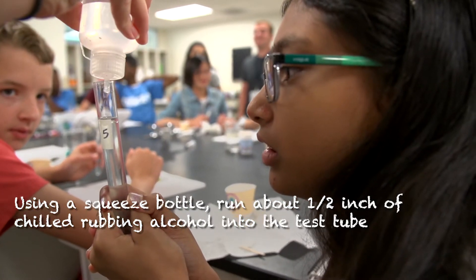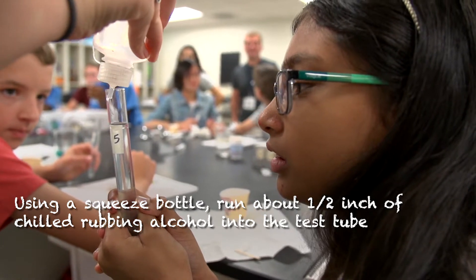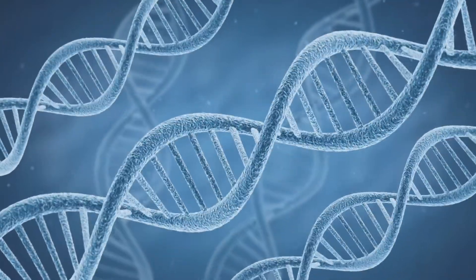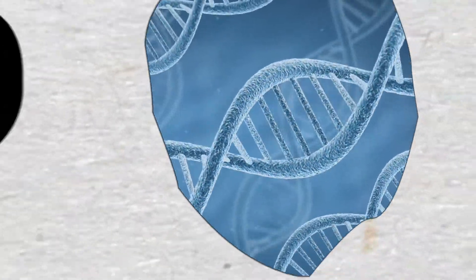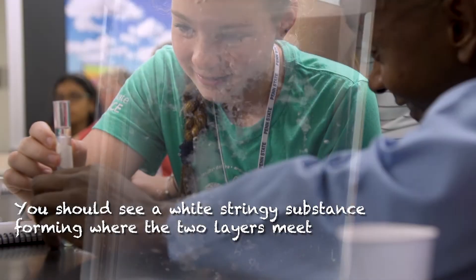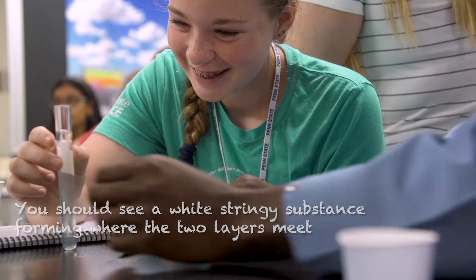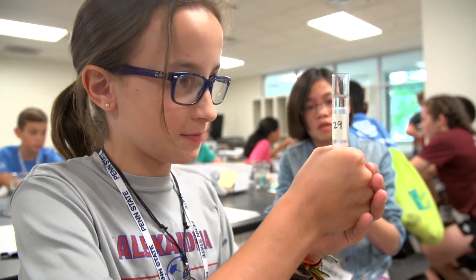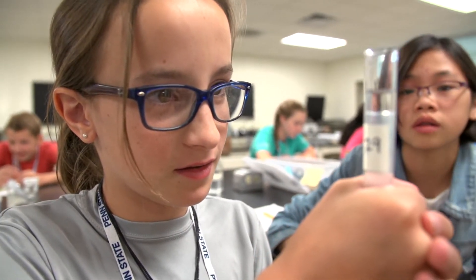And once we shook it, mentors went around and poured rubbing alcohol around the rim. Human DNA is hard to see — a million strands can fit into the period on the end of a sentence. But in this experiment, because there are so many strands clumped together, they suddenly become visible. It was like a separate layer that your DNA strands were in, and you could see the DNA strands — it was really cool, because you could see them twirling around.